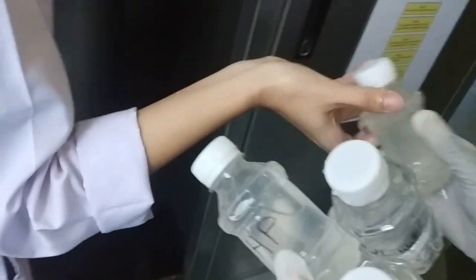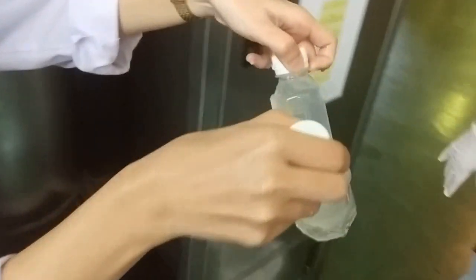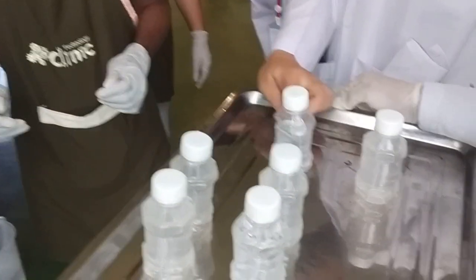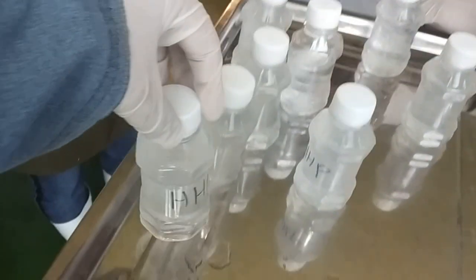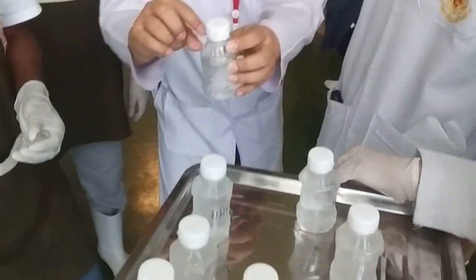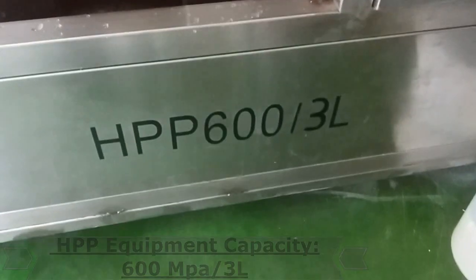Is it hot? No, it's not hot — it's okay. So we have two extra bottles. Water, water, water — filling with water. It is like that because it's not full, because of the pressure. Pressure will be pressed everywhere. If the space is not full, some pressure can cause issues — some liter bottles can deform. So this is our pressure result.